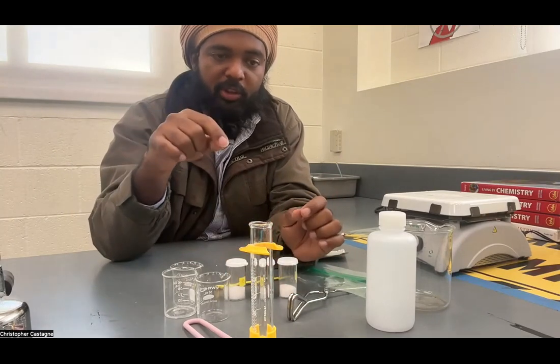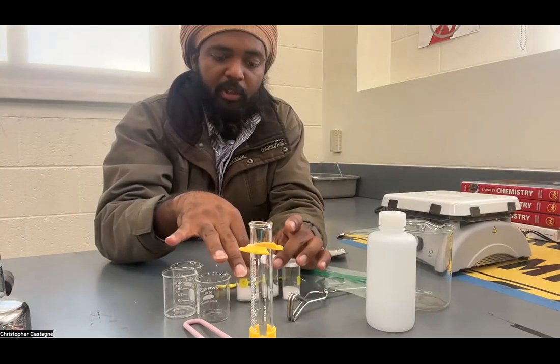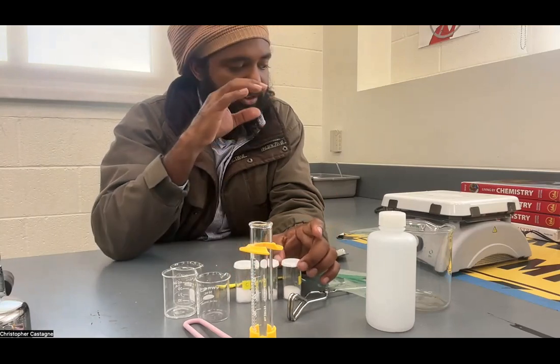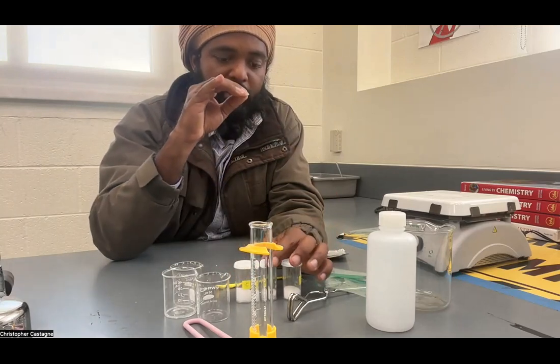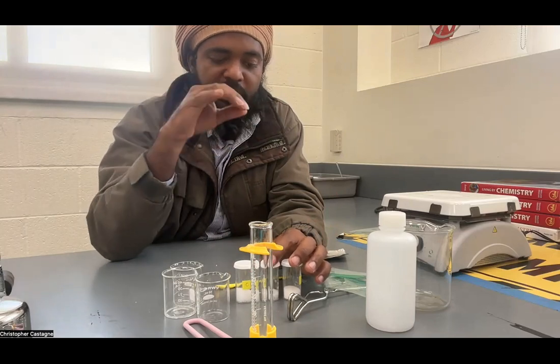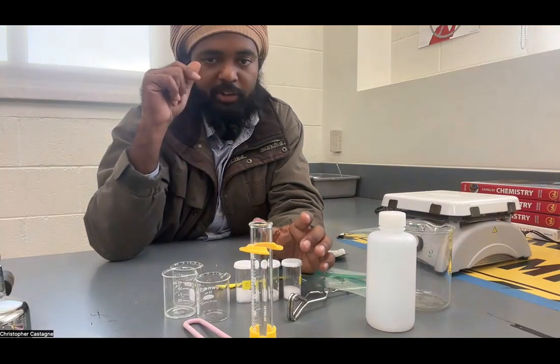I'm going to go through in this video the first part of the lab, which is the experiment itself. Part B is where we do all the reasoning and deduction and solve the case.